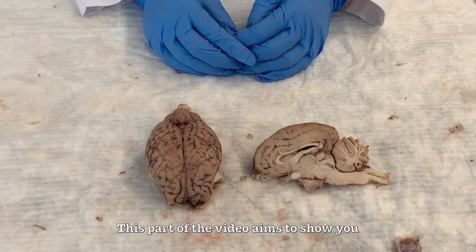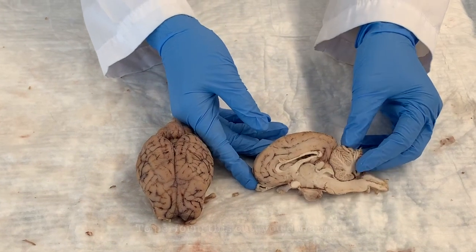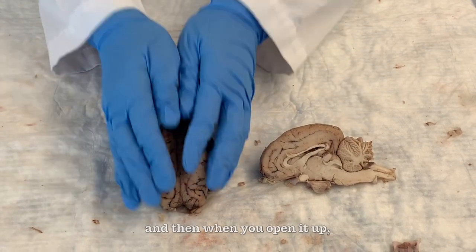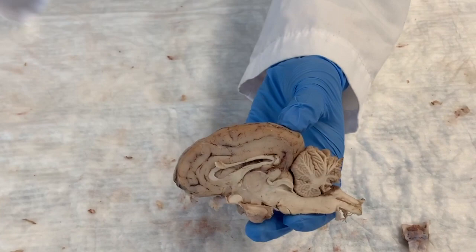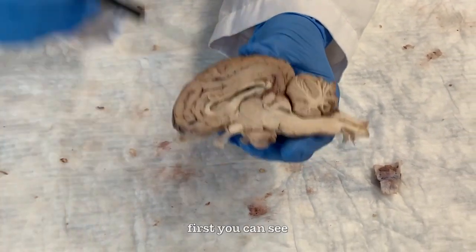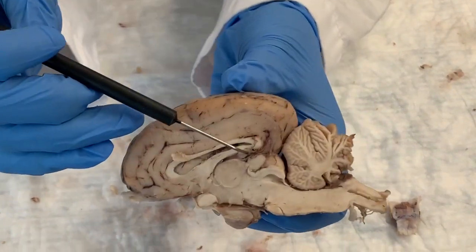This part of the video aims to show you the structures of the brain that are visible from the mid-sagittal cut. To perform this cut, you want to cut along the longitudinal fissure of the brain, and when you open it up, you get the sagittal cut. So if you look at the brain from the mid-sagittal cut, first you can see the thalamus, which is the circular structure right in the center of the brain.